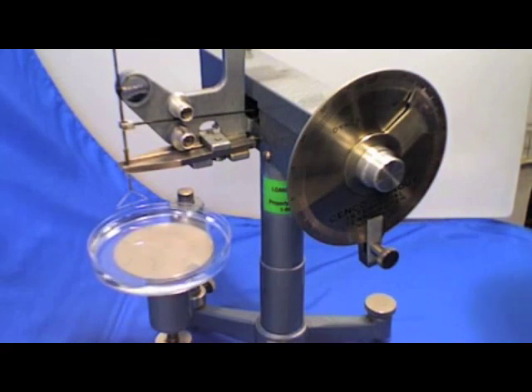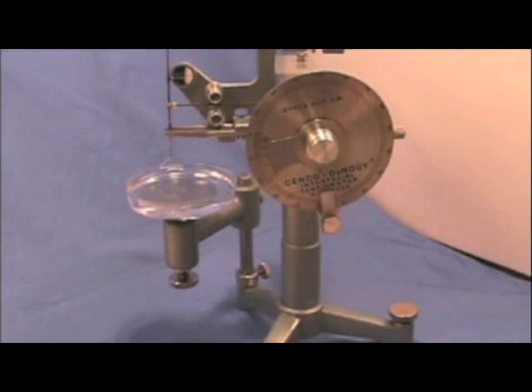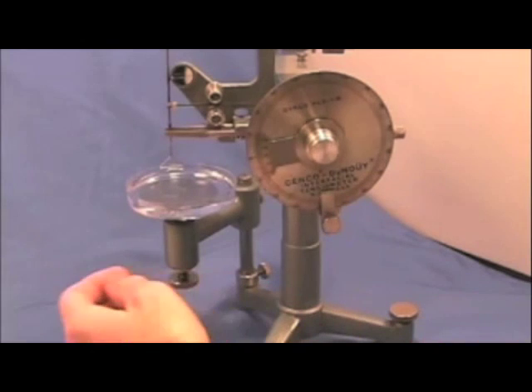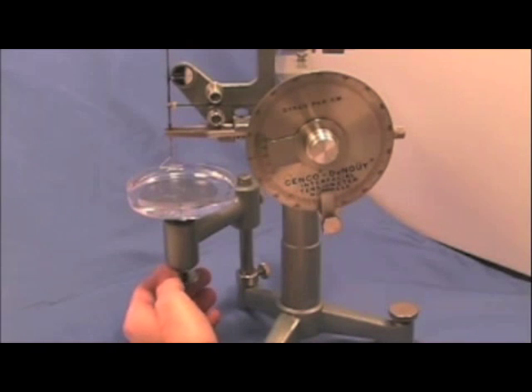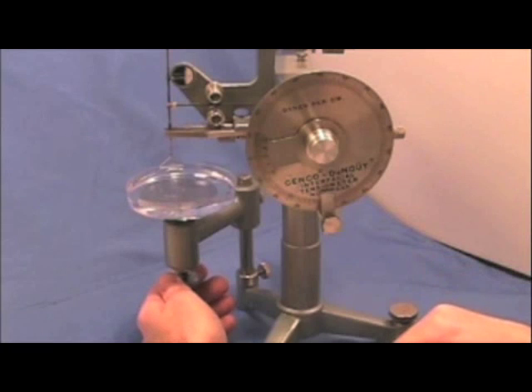We're going to do a test here for surface tension on distilled water. We're going to lower the table to the point where the needle starts to be deflected from the surface tension, so we're going to lower it so that the ring becomes closer to the surface of the water.